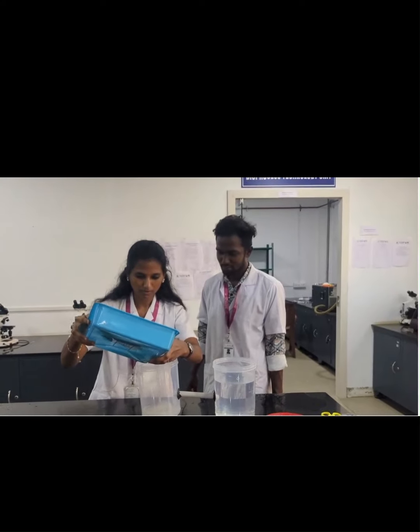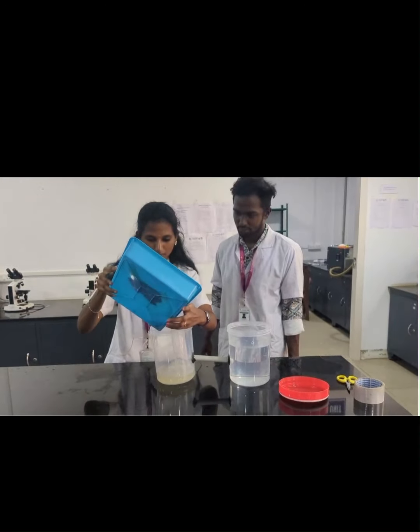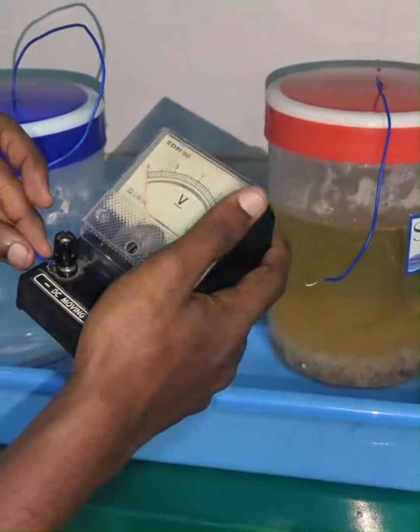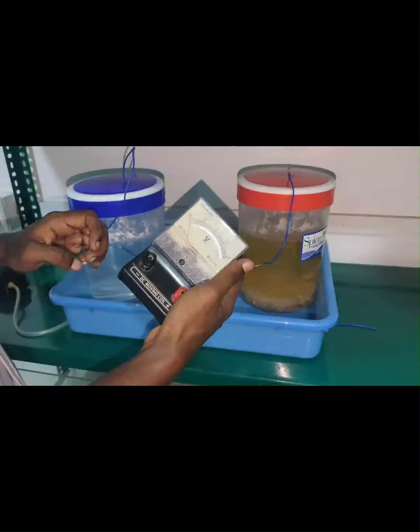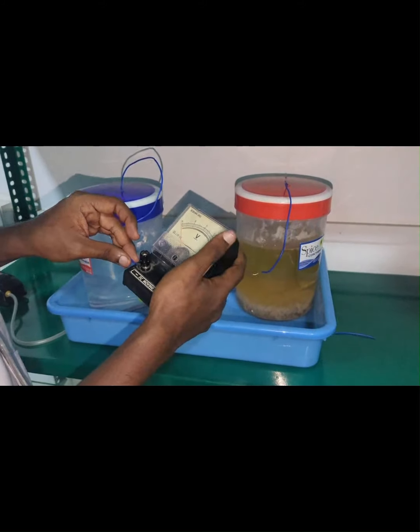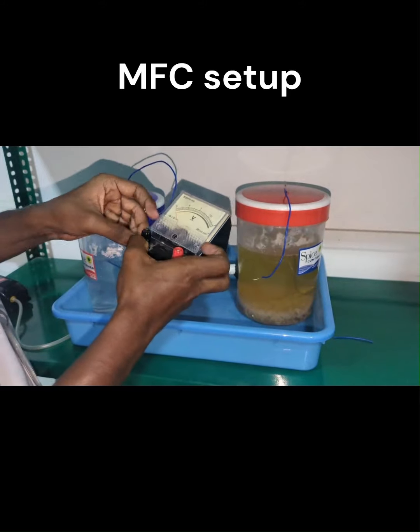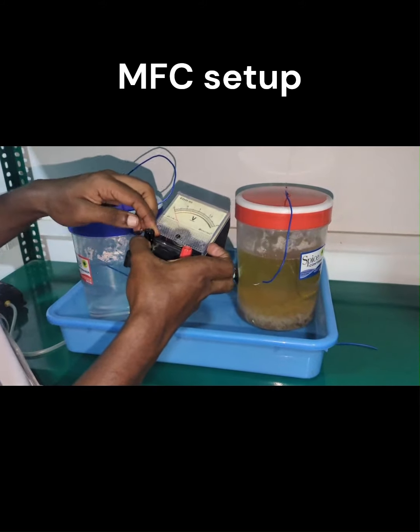The fermented water has been added to the second container, and the total volume has been made up to two liters in both containers. Finally, the MFC setup has been completed — the electrodes have been attached with wires and connected to the voltmeter.